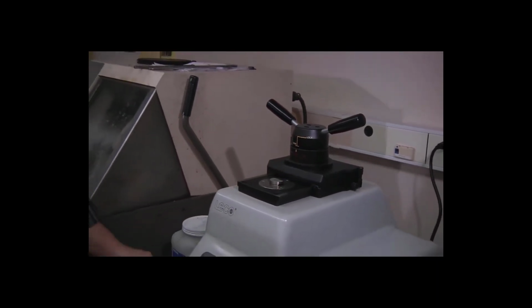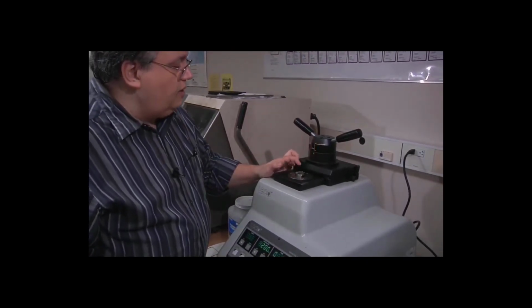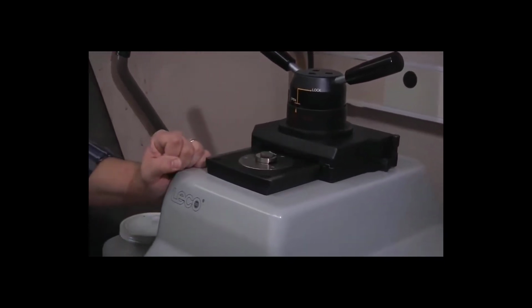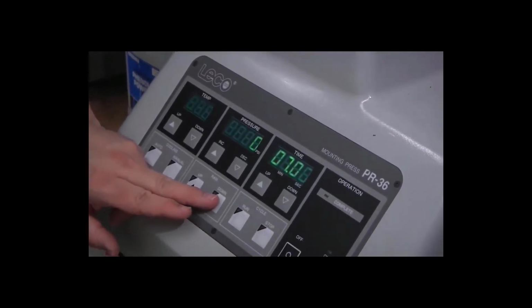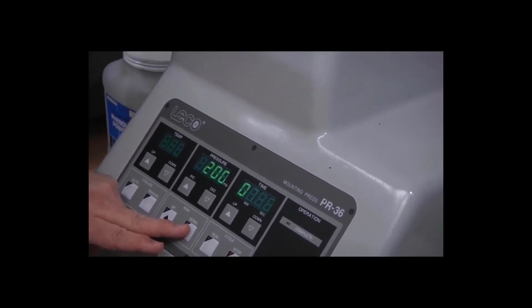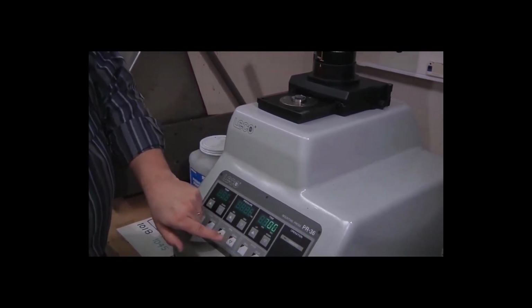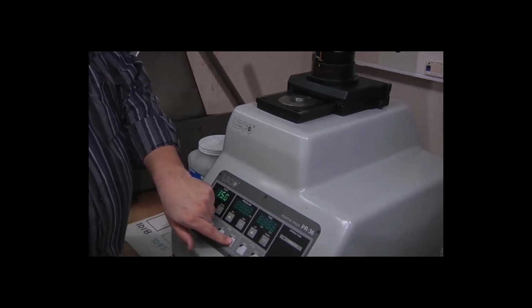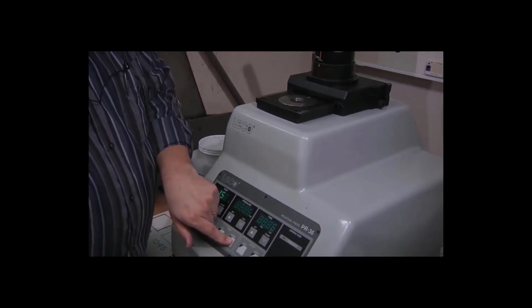To begin the process, just going to take my specimen, place it on the ram, center it just by eye as well as I can. We want it to be centered in our final specimen. And press the ram down button. Depending on where in the cycle you are, you may just be able to press the button once and it will go all the way to the bottom. This is typically what happens on the second and the third try. For the first try, I need to hold the button down until it gets to the bottom. We'll hear a slight change in the note of the motor when it reaches the bottom.